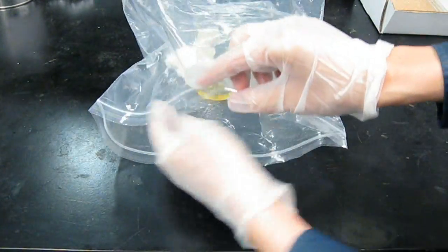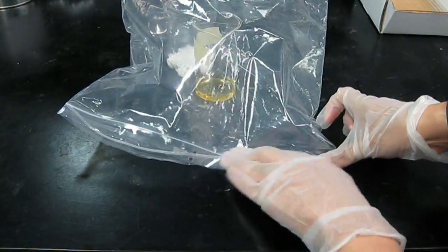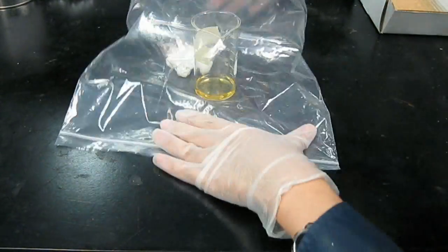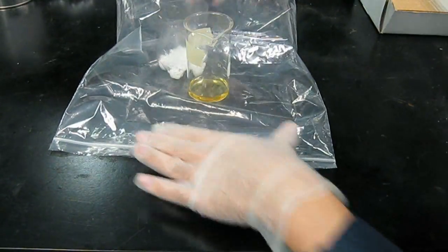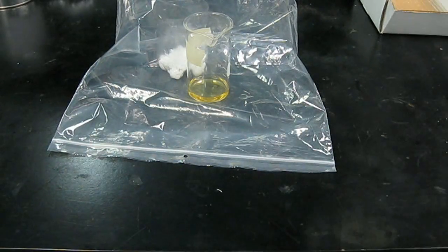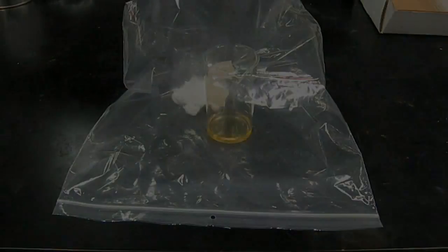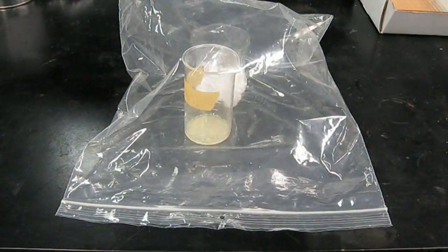What happens is the drying agent is much more hygroscopic than your target chemical so it will make the air in the bag so dry that your target chemical will be forced to start drying out. After a week or two the target chemical is dry. And there it is.